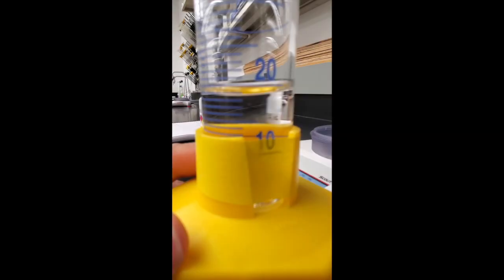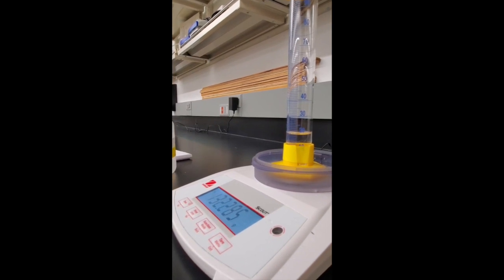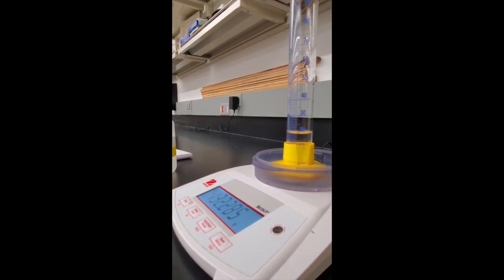The volume of the solution is 18.5 milliliters and the mass of the solution, including the graduated cylinder, is 132.285 grams.